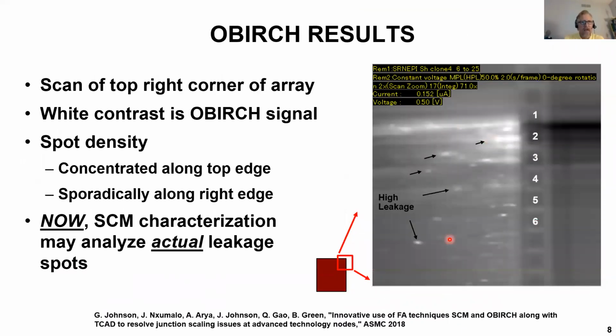Here are our results. This is a scan of the top right corner of an array. The white contrast is the OBIRCH signal. Let's look at what we can learn about the spot density. We can see from this image that it's concentrated along the top edge, and it's also sporadically along the right edge. Now, scanning capacitance microscopy characterization may analyze actual leakage spots and give you an intelligent answer as to exactly what's going on in your sample. That is why you localize.